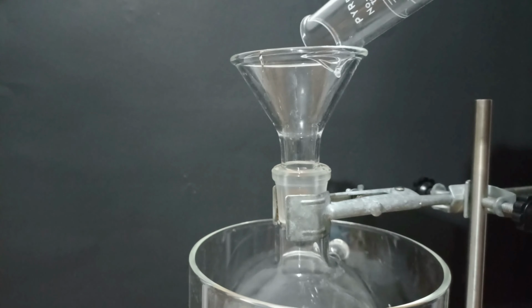The next thing to do is to get rid of the excipient and binder present in the tablets. So I'm going to filter off the solution. Here you can see all the excipient. And that's it. We have a methanol solution containing almost pure paracetamol.